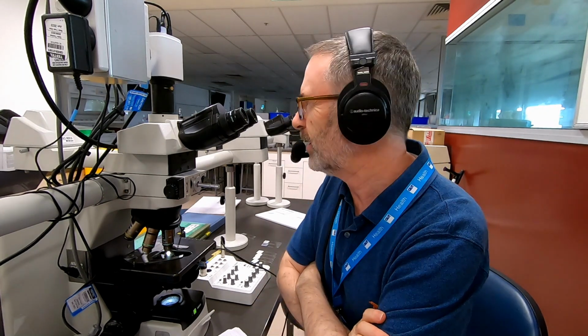Okay, so now the final thing that I'd like to present is some rather creative work that we've done here in the laboratory. One of the benefits of being in a teaching laboratory rather than a routine diagnostic laboratory is that you really have the time to research and explore and try different combinations. And in doing so, we build our understanding of the way that these stains work, and you also gain a better understanding of their limitations.